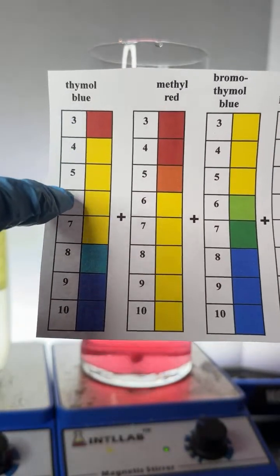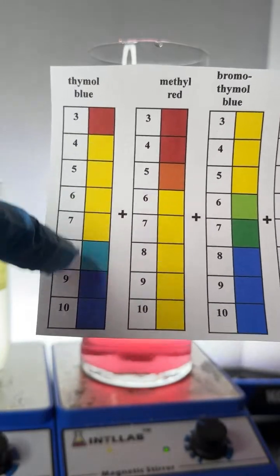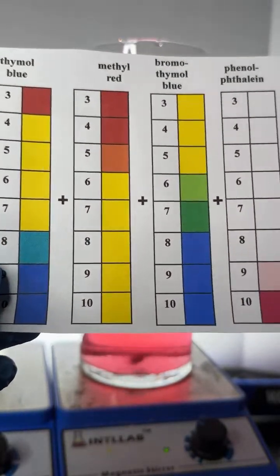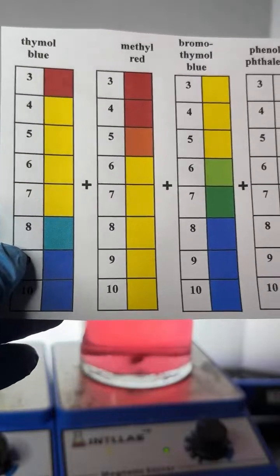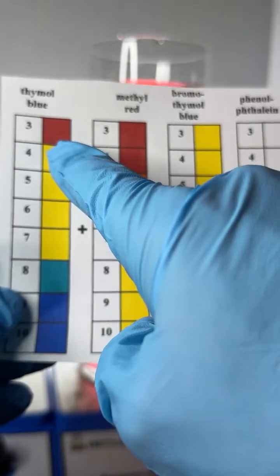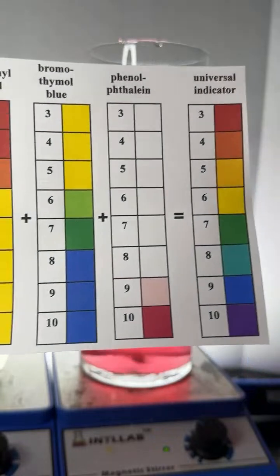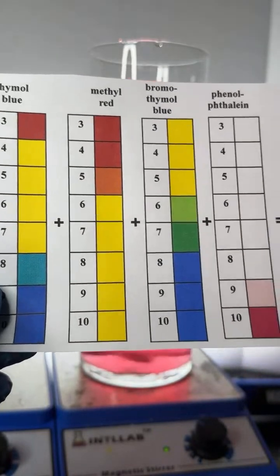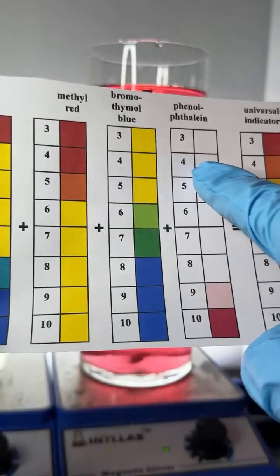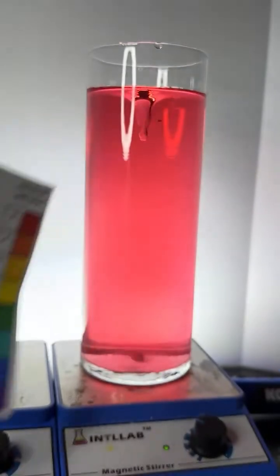We get a lot of the rainbow colors out of thymol blue, but if we just use thymol blue, all we would see is red, yellow, maybe a light blue, and a blue. But we want to see all the colors of the rainbow. So what you do is you add all these other dyes in, which is like adding other colors. And then, at pH 3, you have a red colored dye, a slightly yellow colored dye, and a colorless dye. Altogether, that looks red. And that's just the way it works. So, at pH 4, this red shifts to yellow. Everything else stays the way it is, which is going to shift you from a red to an orangish color, and so forth.